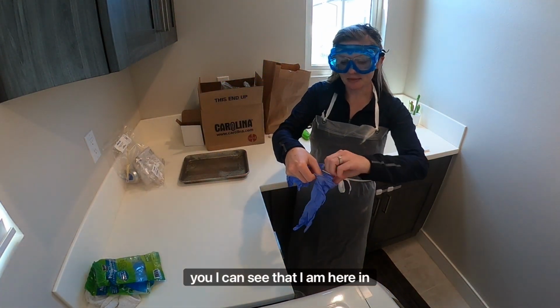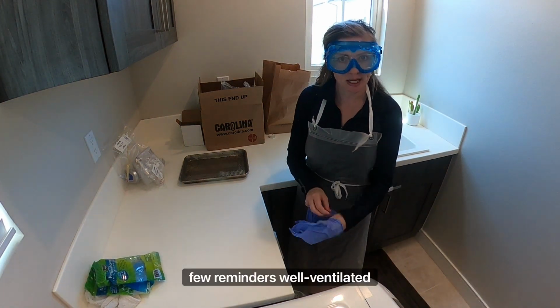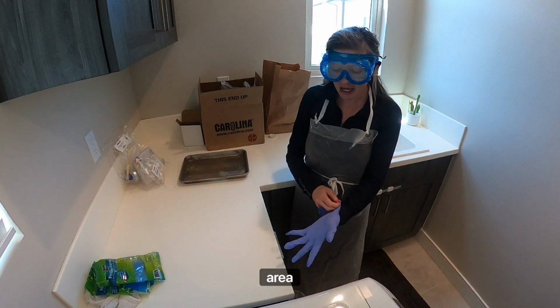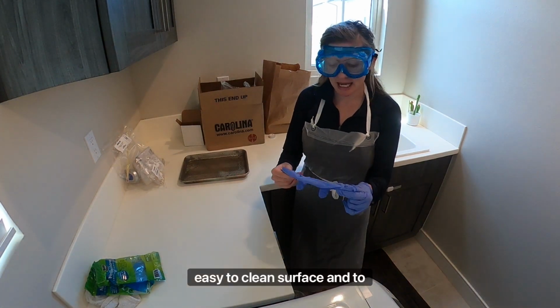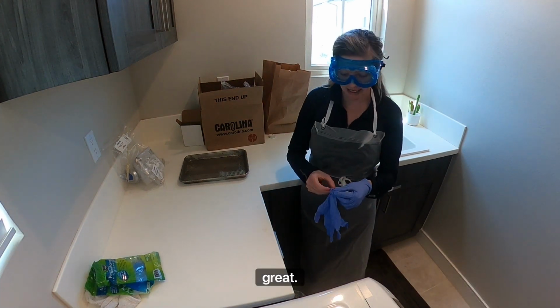Again, you can see that I am here in my lab space, as you will be. A few reminders: a well ventilated area, an easy to clean surface, and to make things a little bit easier, access to a sink is great.